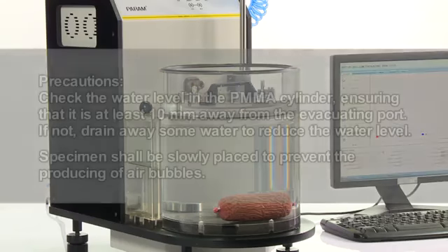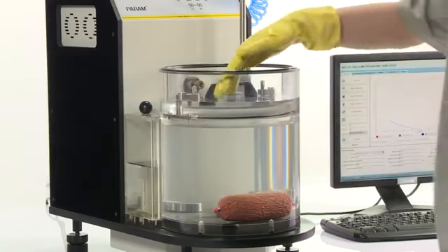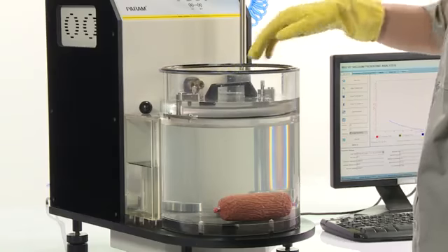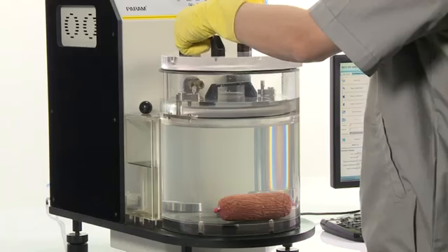Precautions: check the water level in PMMA cylinder, ensuring that it is at least 10 mm away from the evacuating port. If not, drain away some water to reduce the water level. Specimen shall be slowly placed to prevent the producing of air bubbles. Place the exterior lid properly in position.